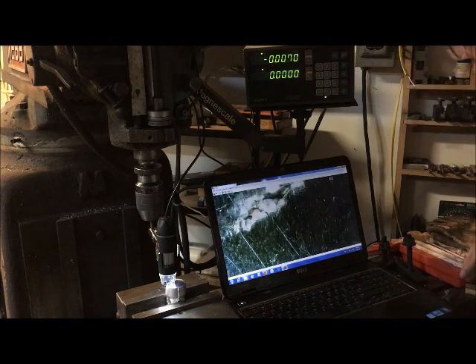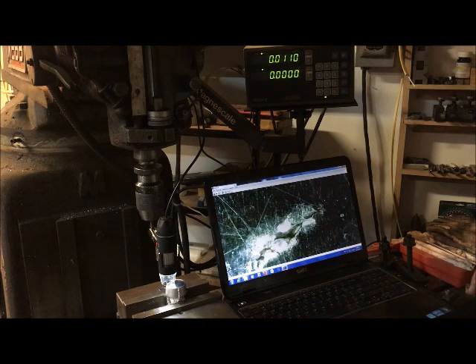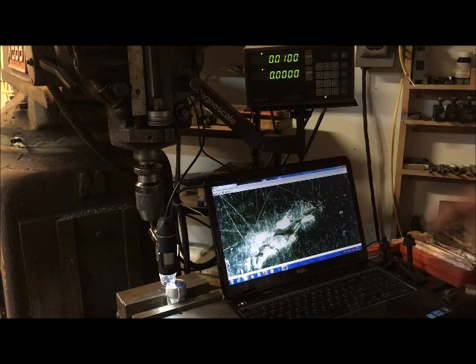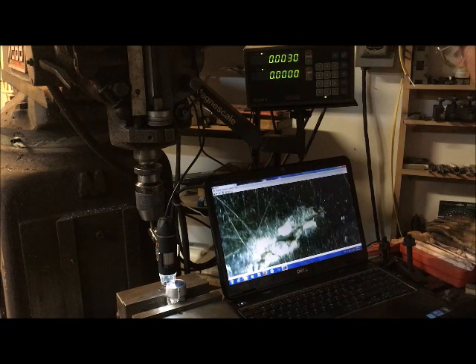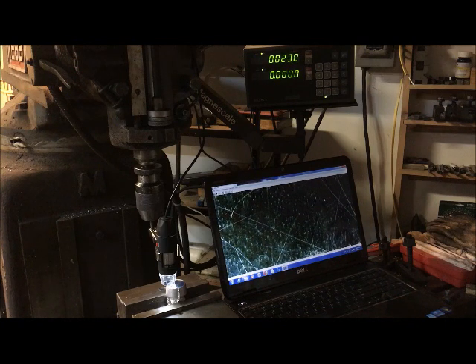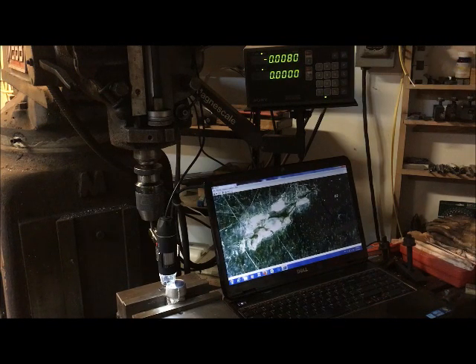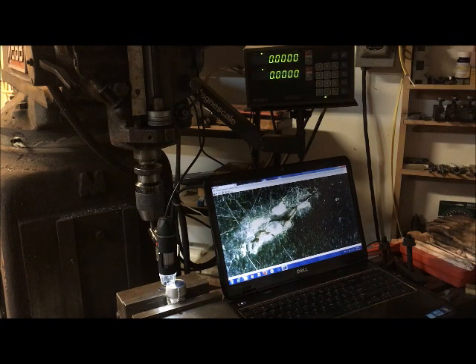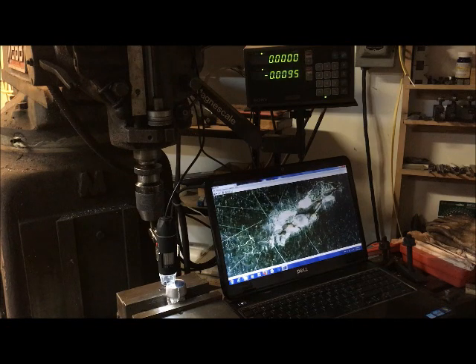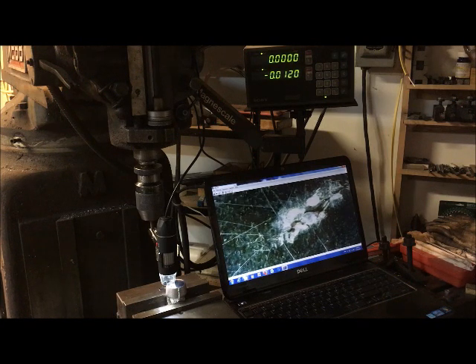So let's go the other direction. Come down to the bottom of the screen. Zero it, and then come back to the same point up here that we call the top of the defect. It's 23.5 thousandths. So it's always consistent within about a half a thousandth. And the same thing for the width. If we look at just what appears to be the open area, okay, we'll zero the Y.